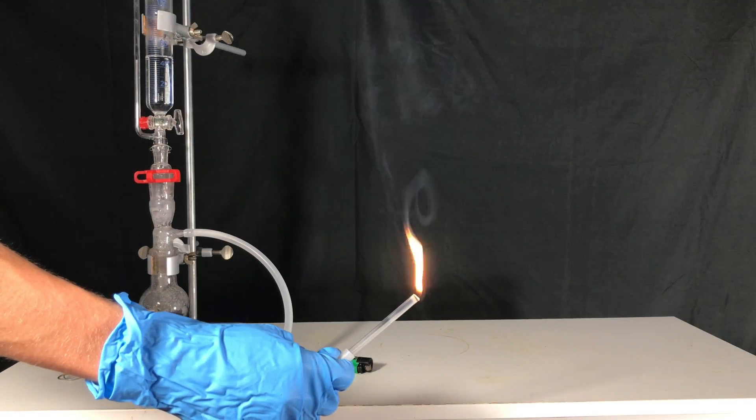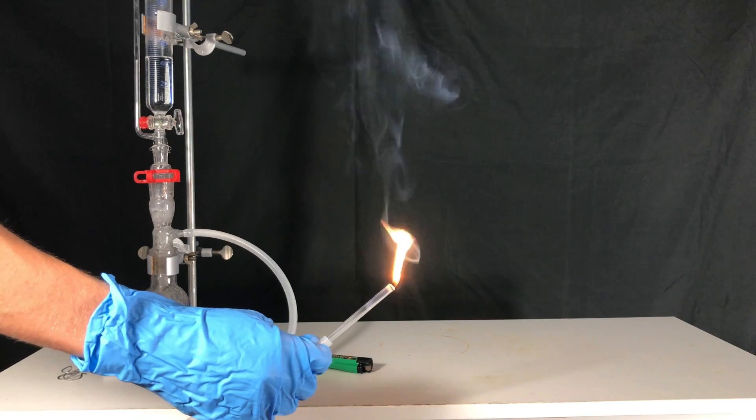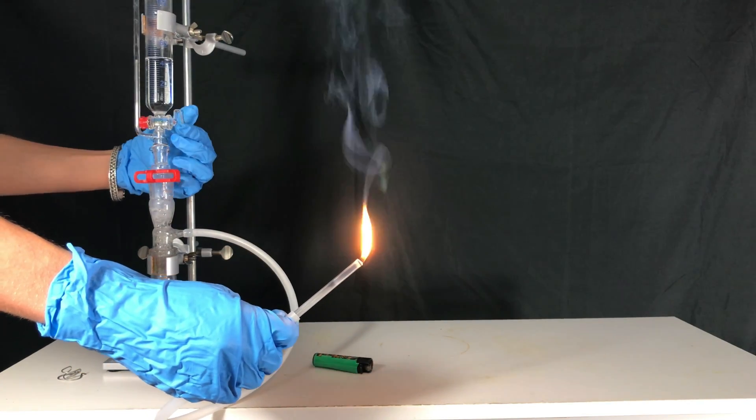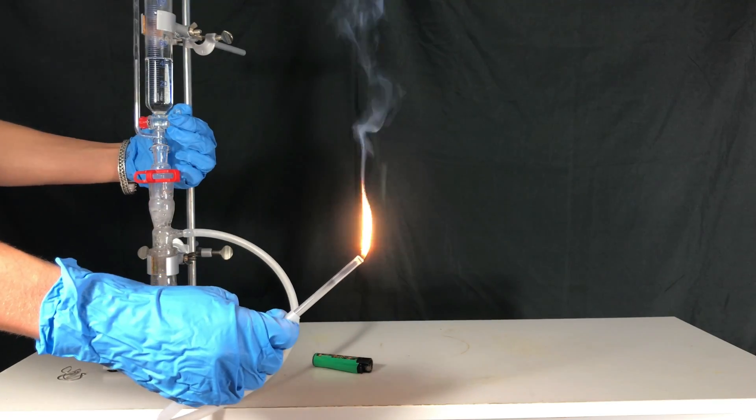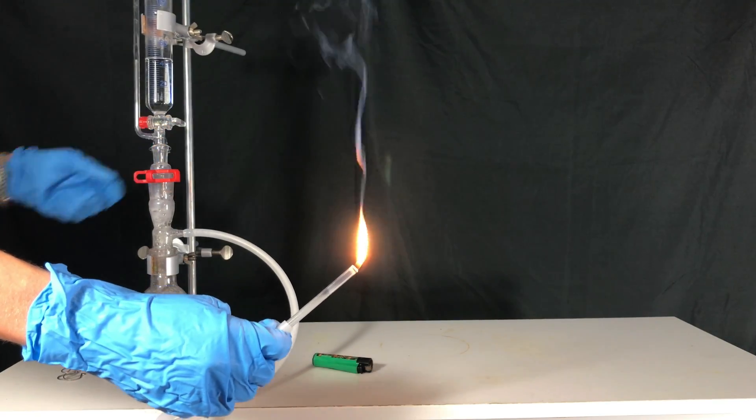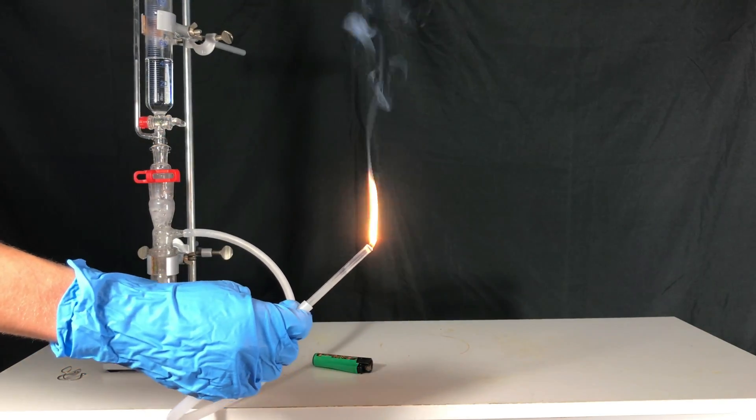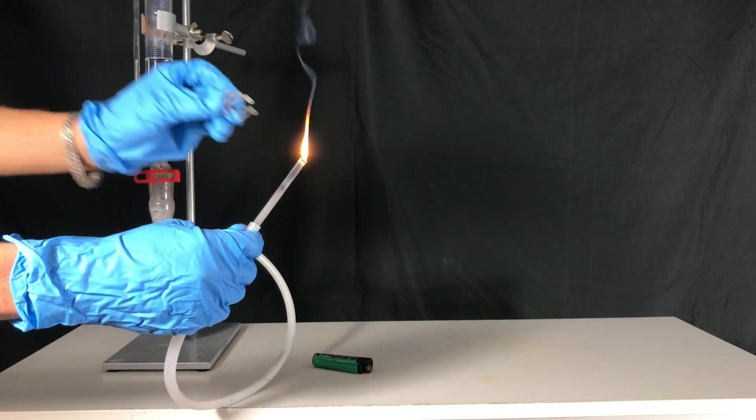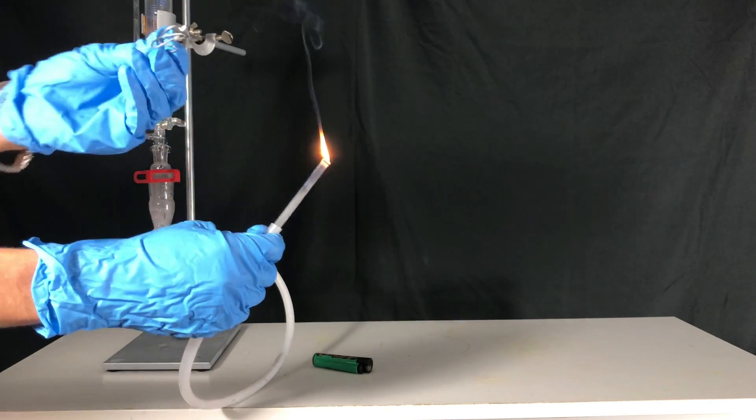The smoke that is formed when silane is burned is actually just silicon dioxide, better known as plain sand. You wouldn't want to breathe in sand or silane. Therefore, I wore a respirator during this entire preparation.